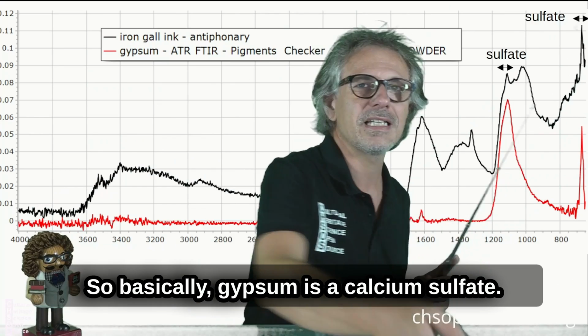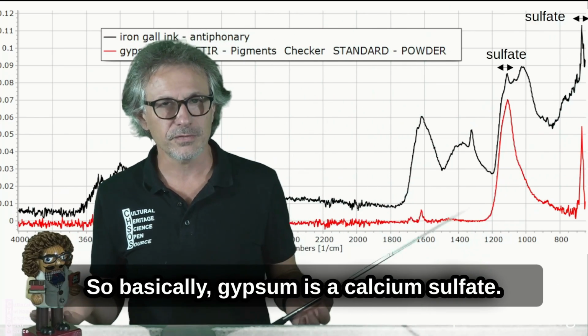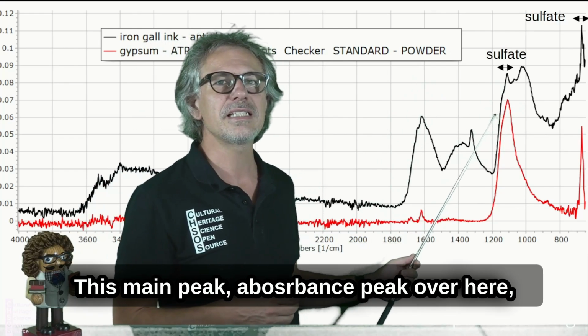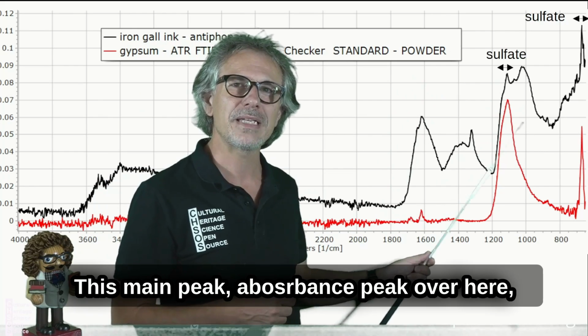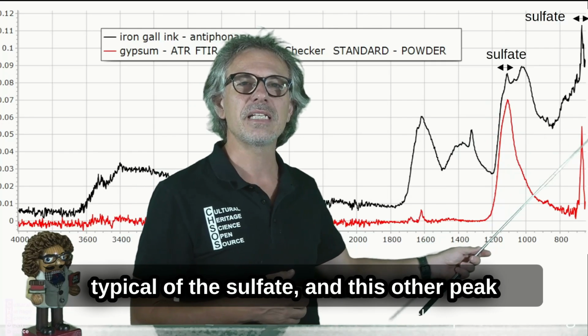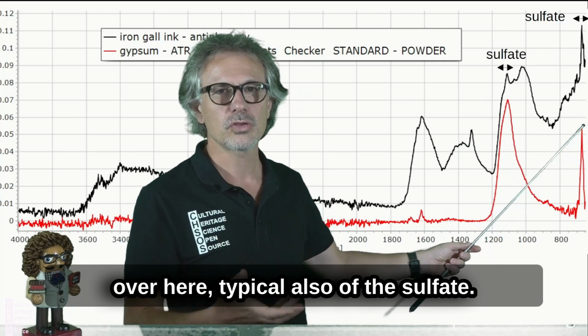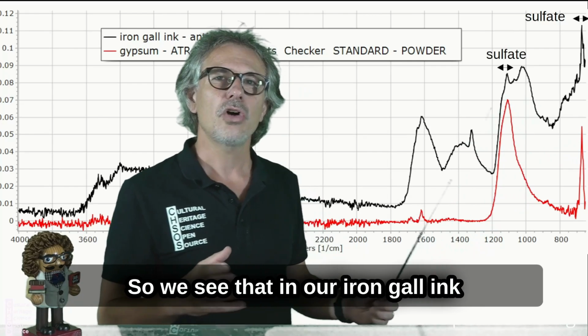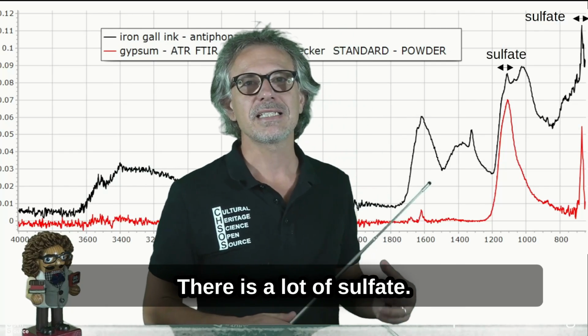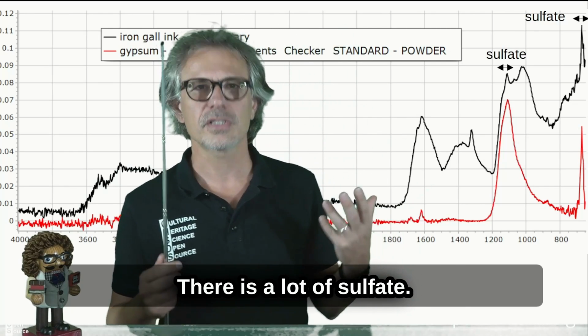Gypsum is a calcium sulfate, and we see these two peaks: this main peak, typical of the sulfate, and this other peak over here, also typical of the sulfate. So we see that in our iron gall ink there is a lot of sulfate.